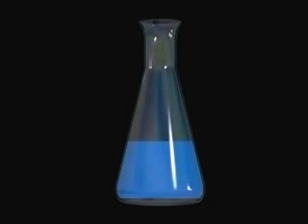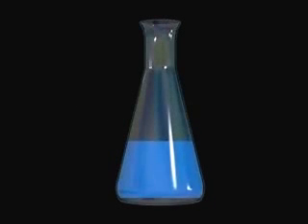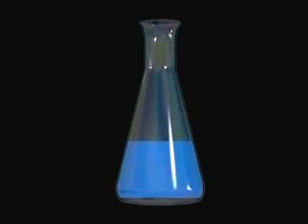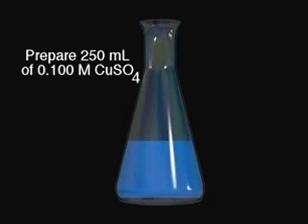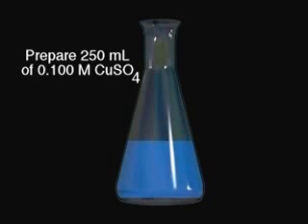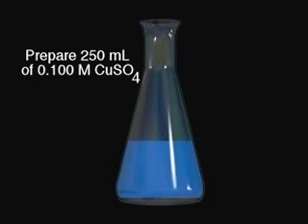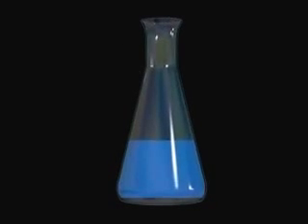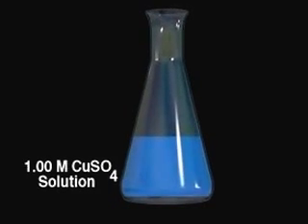Suppose we wish to form a solution of known concentration by diluting a more concentrated solution of known concentration. We wish to prepare 250 milliliters of a 0.100 molar copper sulfate solution, beginning with a one molar stock solution.